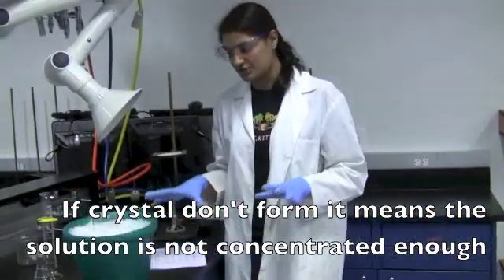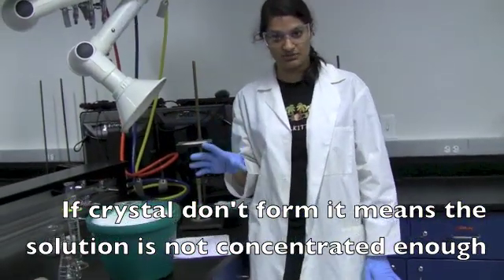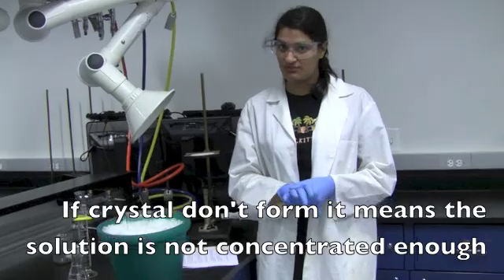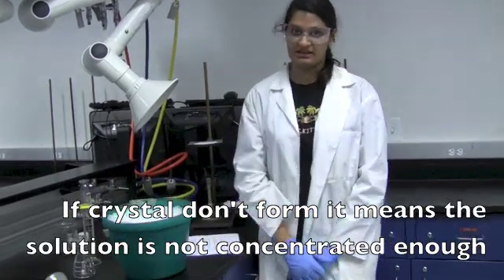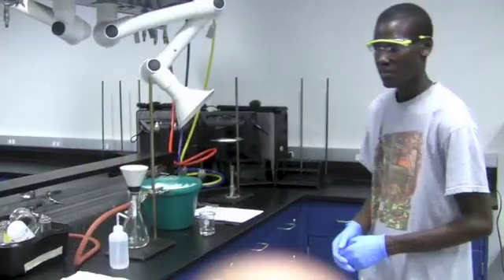Now in these 10 minutes, you're going to see crystals slowly start to form. However, if crystals do not form, you're going to have to go back and reheat the solution one more time and place it in the ice bath again.